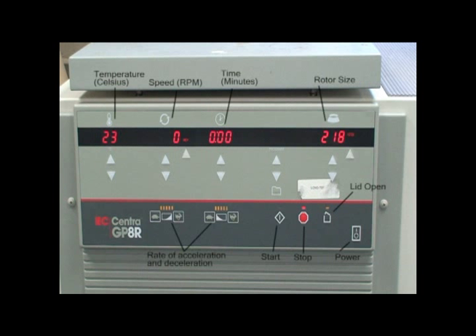This centrifuge has a digital readout of temperature, the speed and duration of the spin, as well as displaying the rotor size, although this particular centrifuge should automatically detect a rotor change and not require a manual adjustment.